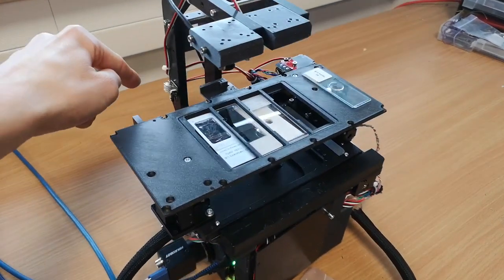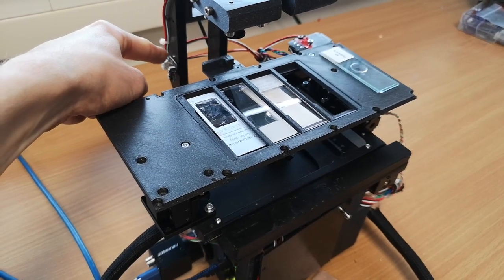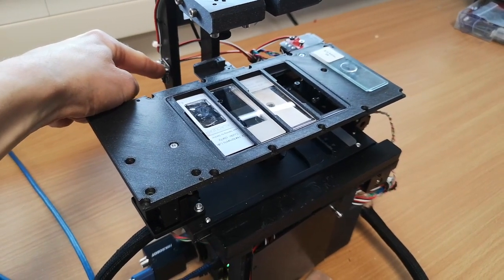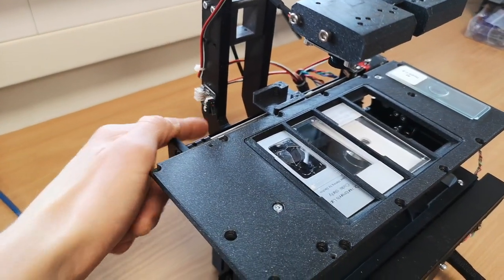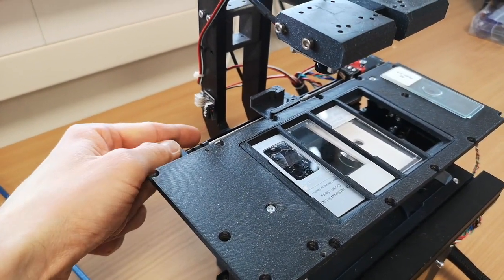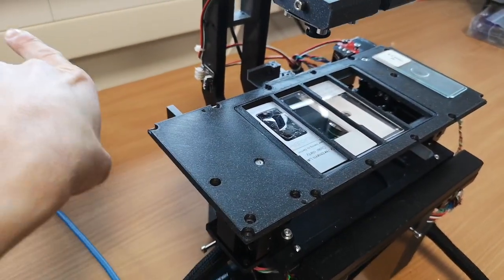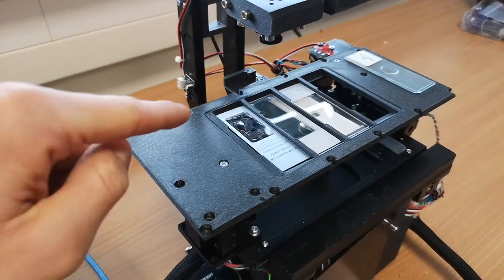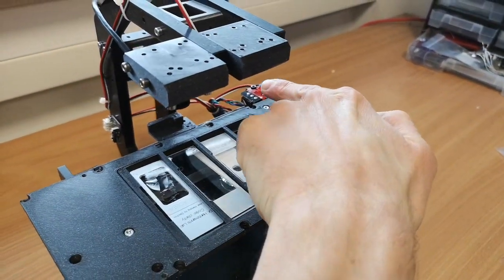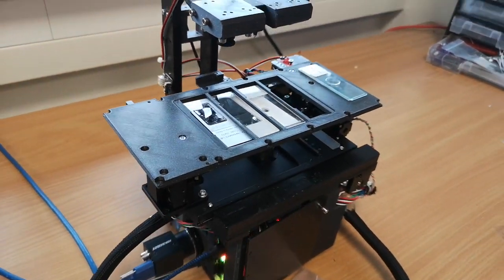So we have different end stops. It may be that it's not the case in your microscope, but we can also make sure that this will happen. And this defines the zero. So whenever the microscope's touching the back here, it sets the position to 0. So along this direction it's Y, and along this direction it's X. So from here, there it's positive, from there it's also positive.